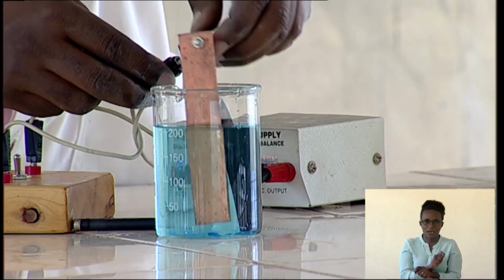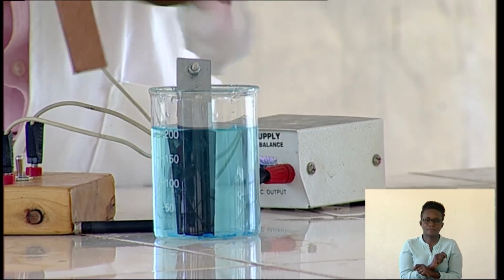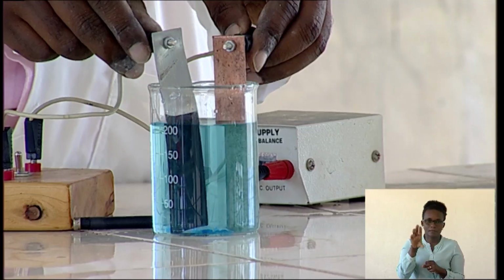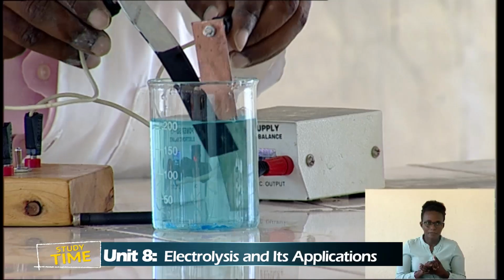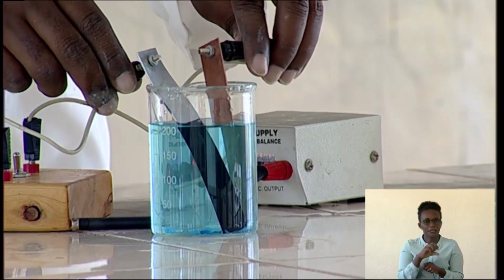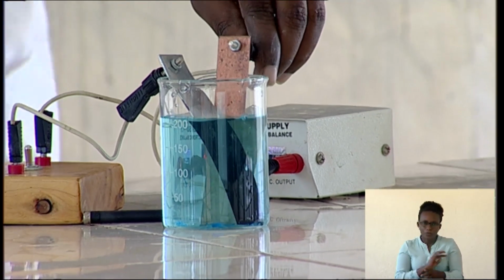So we are using the same electrodes here. The electrodes are the same; they are all made up of the metal. So what is happening to this one? There is something that is coming on this electrode. Something is coming here. And what could that one be? If you can predict, what could it be?